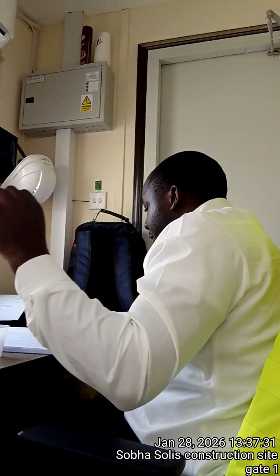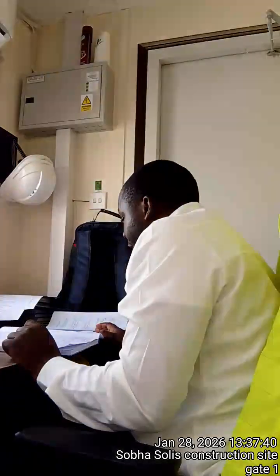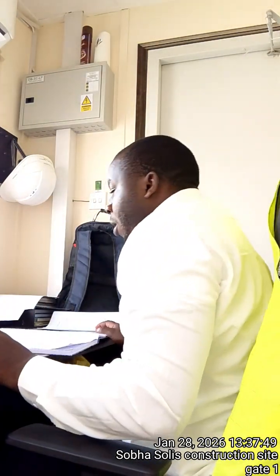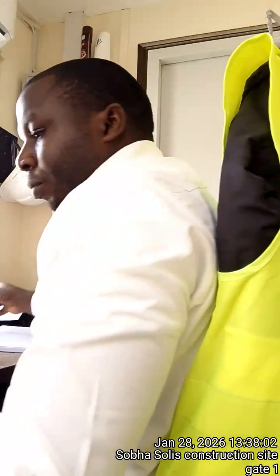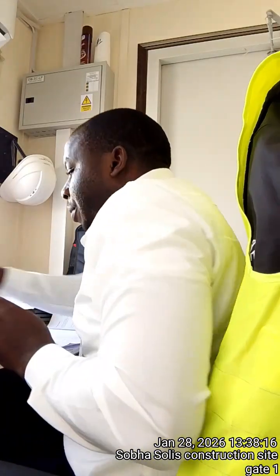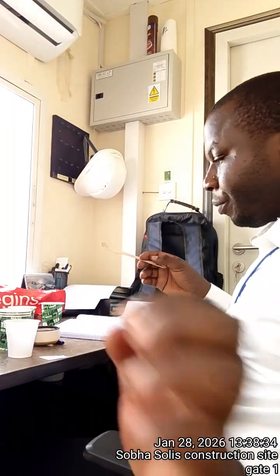So what we shall need mostly is the sodium bicarbonate and acetic acid. We have it here. Small container, I have this one. Always remember to clean this after use if you don't have enough. We have a heat source. I'm going to use the already boiled hot water. So this water is boiled, I think you can see. So we shall need this warm water. Then we'll need this spoon for adding the samples to get the balanced composition.